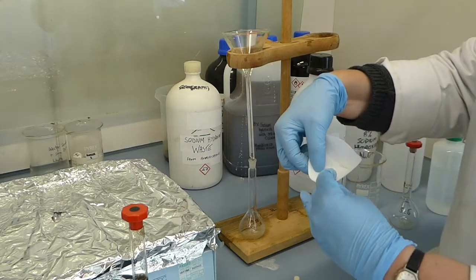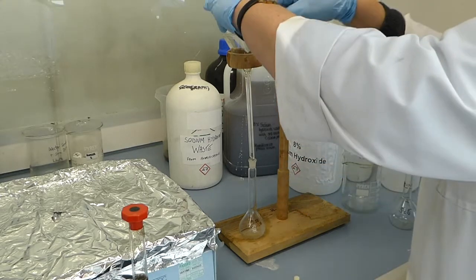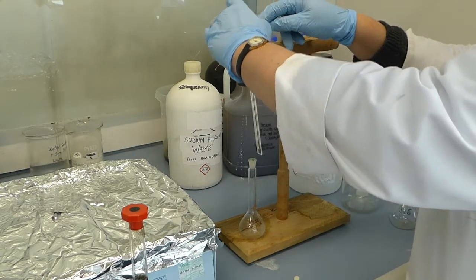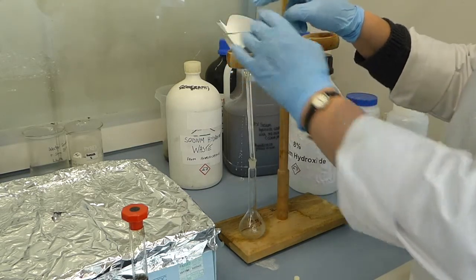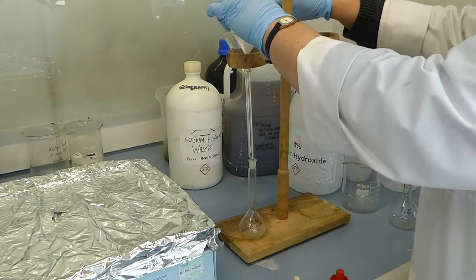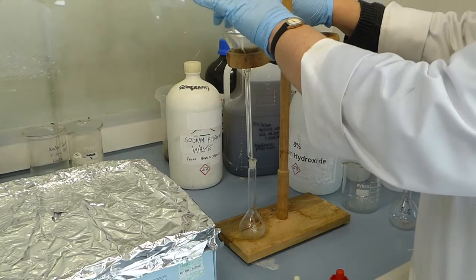Place that in your funnel and then you want to filter 50 ml exactly into the 50 ml volumetric flask from the 200 ml solution.